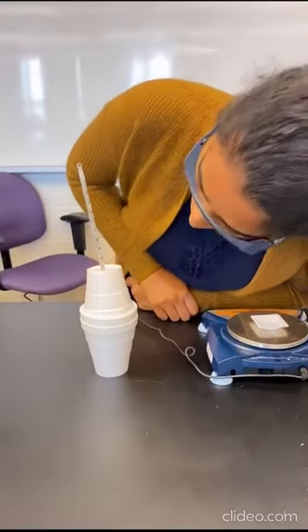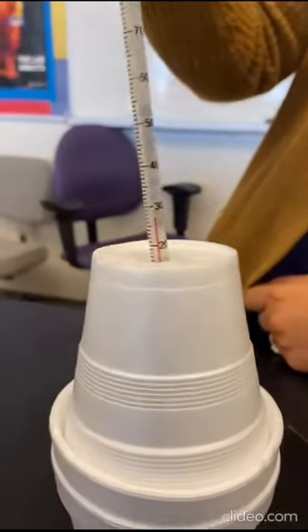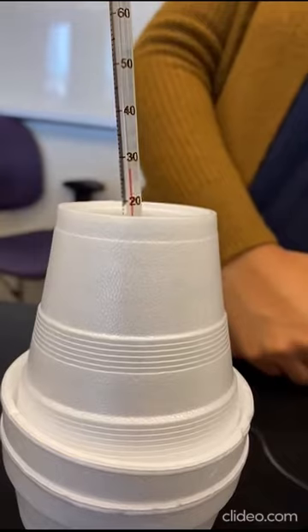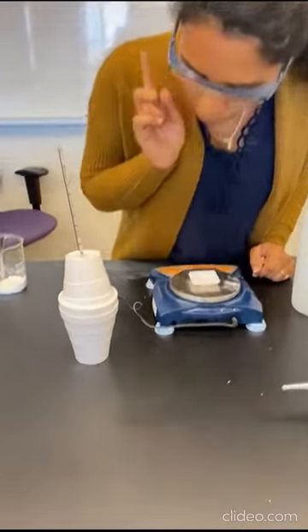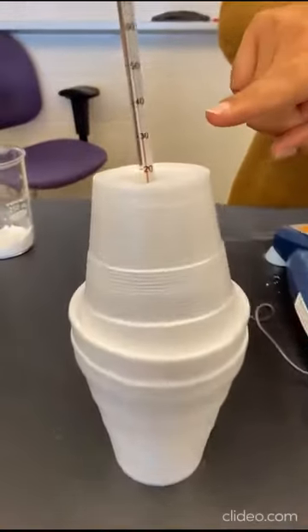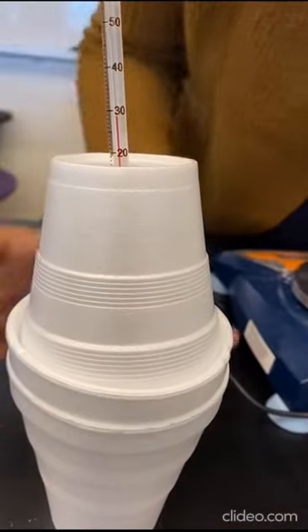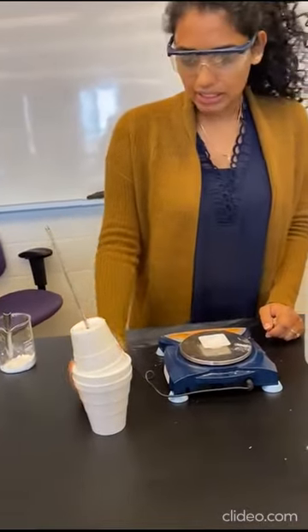So I can see that the temperature is slowly climbing up. So remember, we started at 25. It's going up. We're gonna pause. You probably don't hear the fizzing anymore, and you've probably noticed that the temperature has increased. So I would say, I'm just gonna turn this towards me, that the temperature is now 30 degrees Celsius.